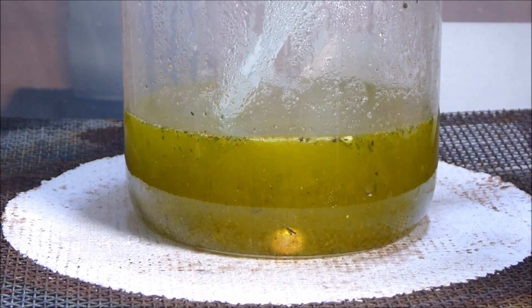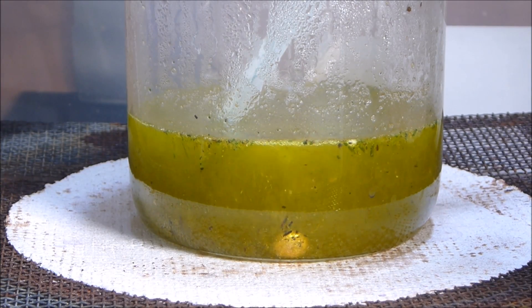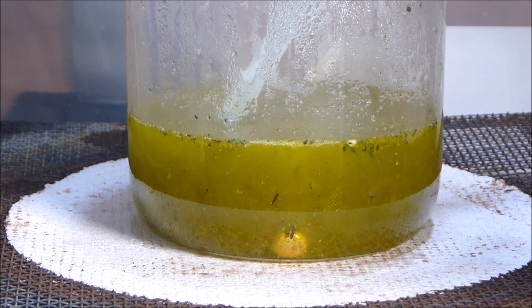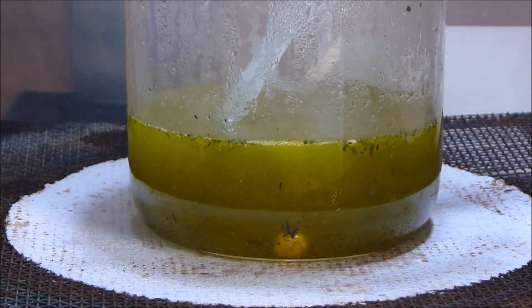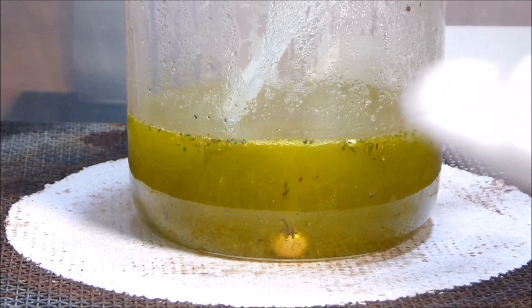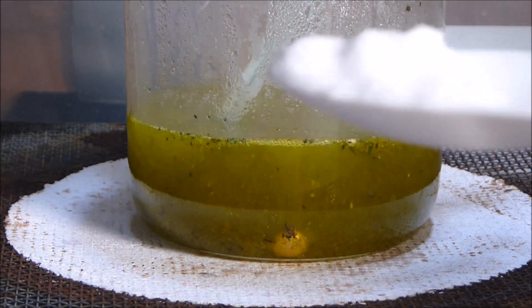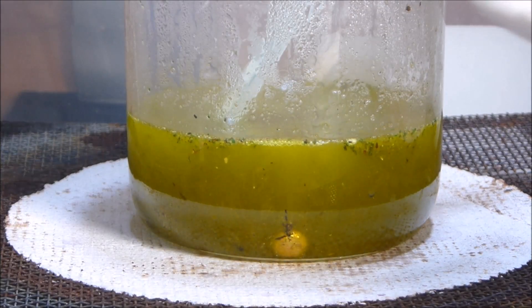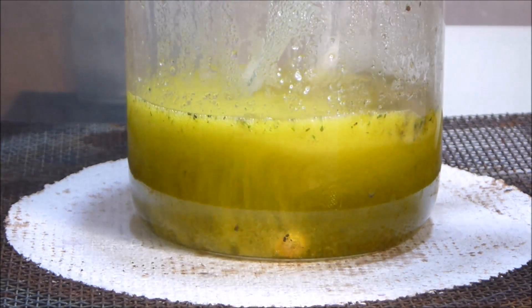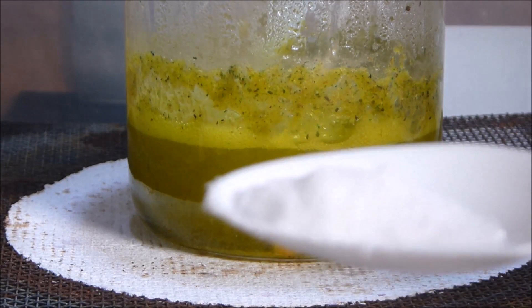The solution is now sitting at about 94 degrees Celsius. We're going to turn the heat down a little bit — that's nice and warm. You can see a very vigorous reaction happening there with my gold button. What I'm going to do now is add sulfamic acid in dry powder form, just a little bit at a time. I've got about a third of a tablespoonful here, which might already be too much for the amount of nitric acid in there, but we'll find out.